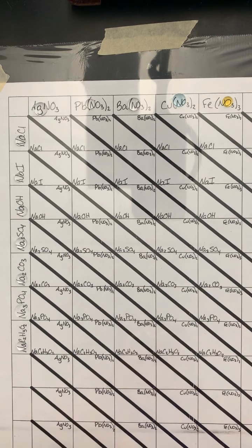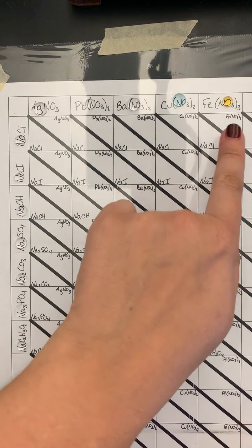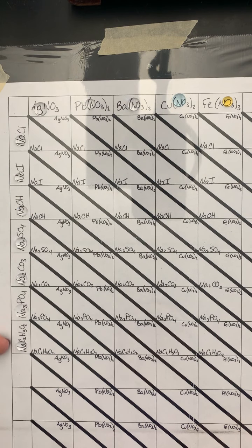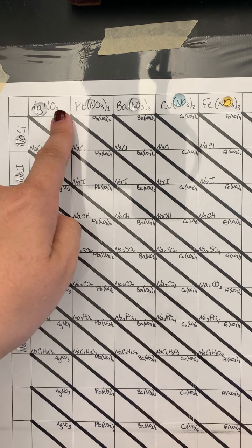So I have my reaction grid set up here that is going to allow me to systematically combine all the different pairs of reactants that I want to do. So right now I have a sample of each reactant by itself along the outer edges just for reference, so you can see what they look like before reaction to compare that to after to see if anything really happened.